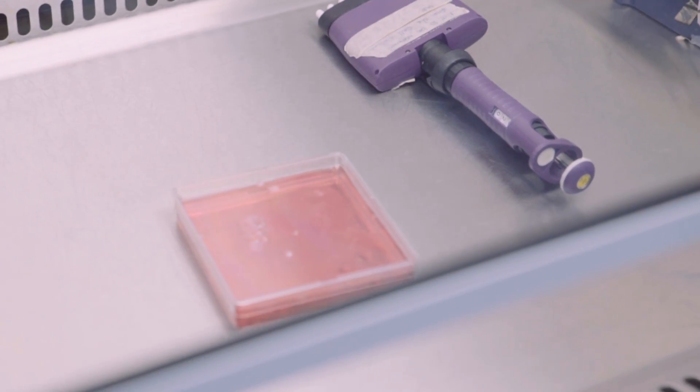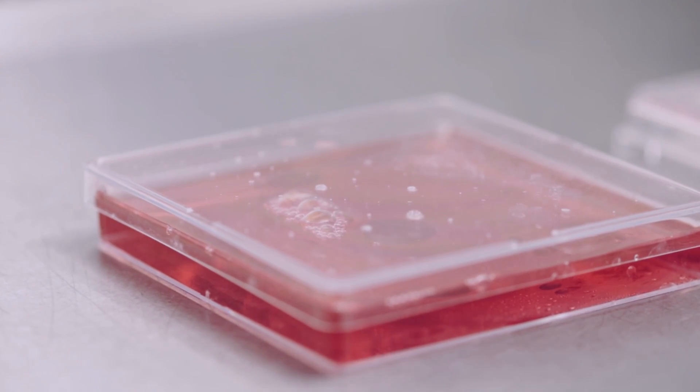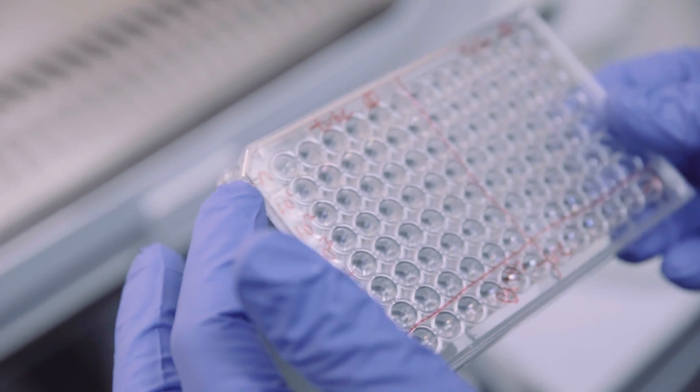In this dish here are some African green monkey kidney cells. I'll add the toxins — the toxins will get into the cell, they'll go for the same target that they do in intestine cells, and cause the same symptoms, which is a loss of structure and the cells round up. It's a very visual process; you can really see the difference between healthy cells and cells which have been treated with C. diff and rounded up.